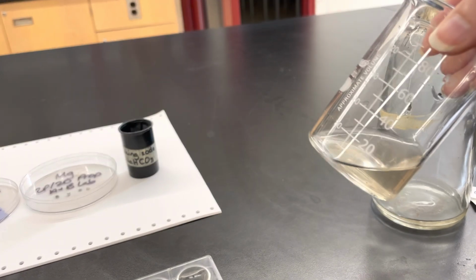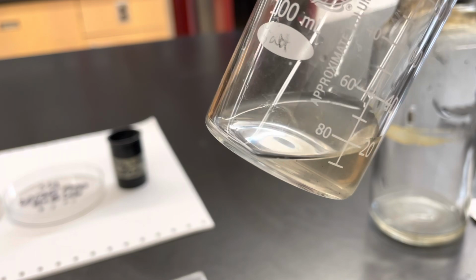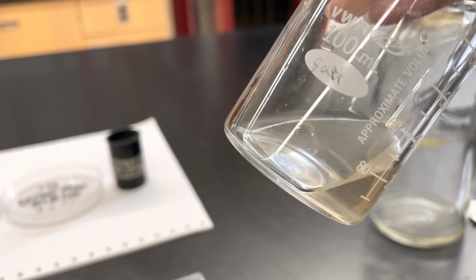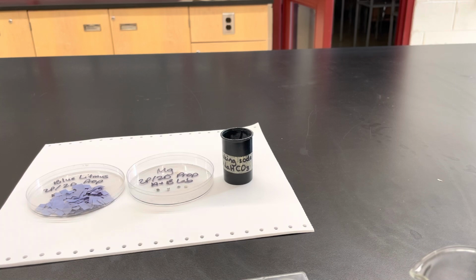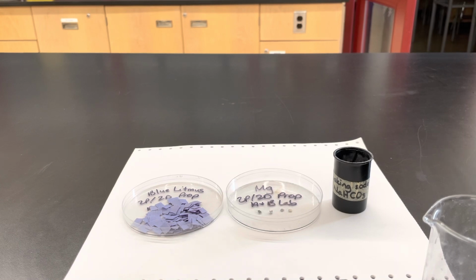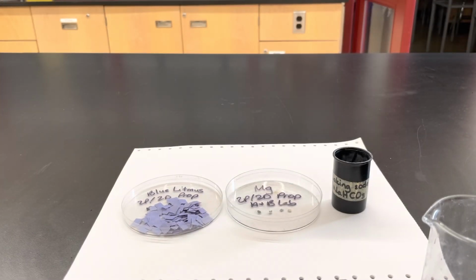Okay, so we've poured our acid out into the beaker so that we can test it. You can see in the beaker that it's kind of a brownish liquid. It's still fairly clear, but you can definitely see it doesn't look like water anymore. So you can make that observation. What we're going to do is test it with 3 of the substances that we know acids react with. We'll put it in 3 different spots in a spot plate.